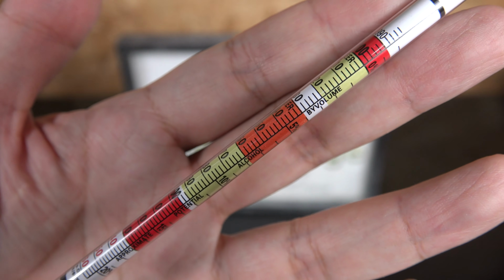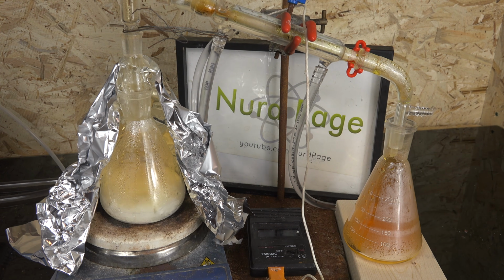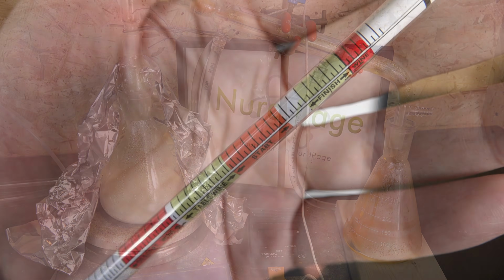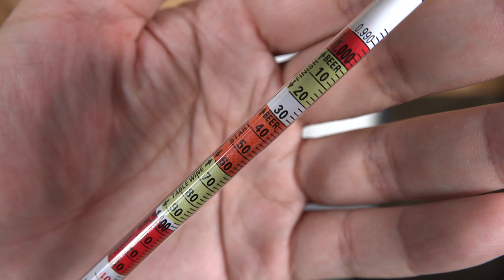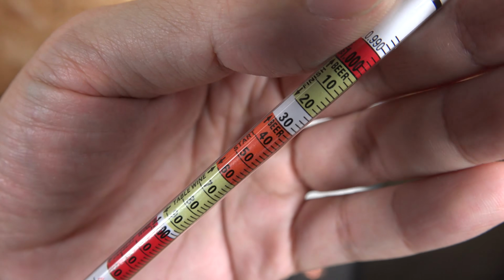The problem is that most common ones don't have much range and usually only measure between 1 and 1.2 grams per milliliter, many even less. Meanwhile, common liquid chemicals like acids have much higher densities, and organic chemicals like isopropyl alcohol have densities less than that of water. Hydrometers with wider ranges do exist, but they are hard to find. So you have to fall back to the graduated cylinder method from earlier.